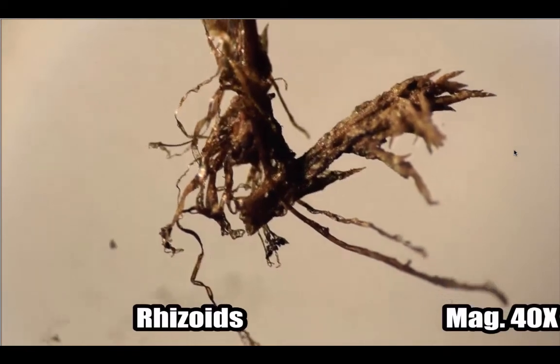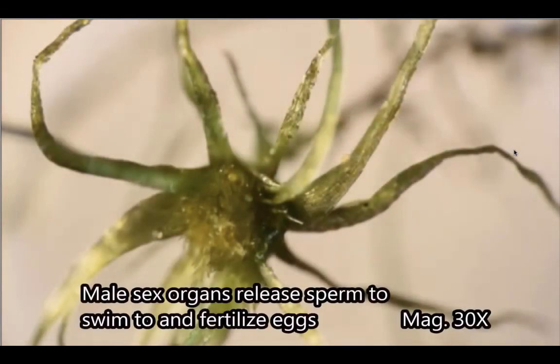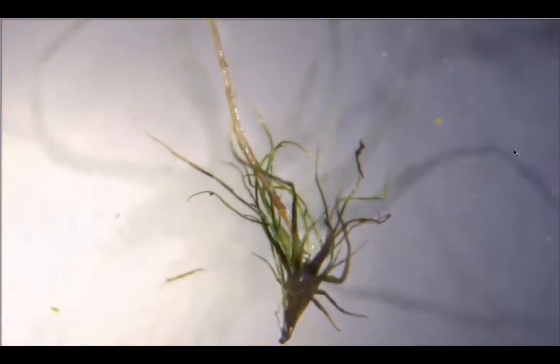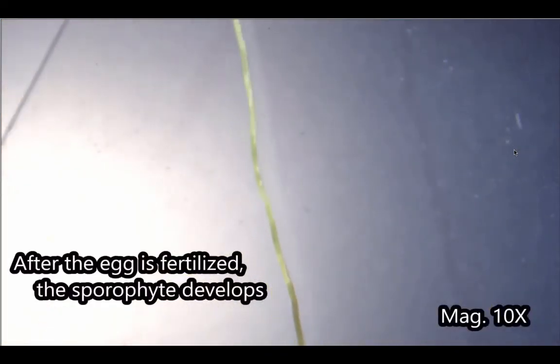Now these are the hair-like structures, the rhizoids, towards the bottom. And that's the seta coming up.